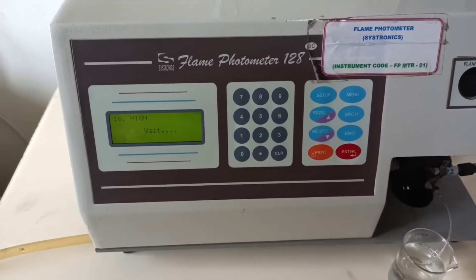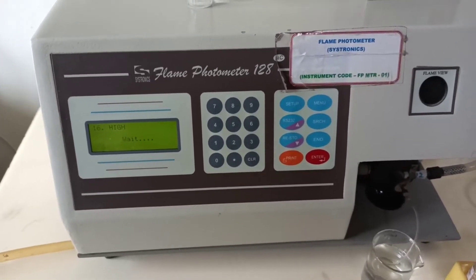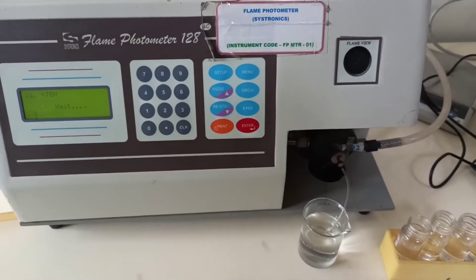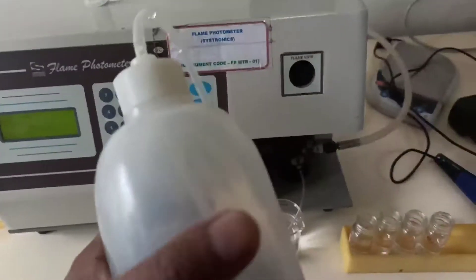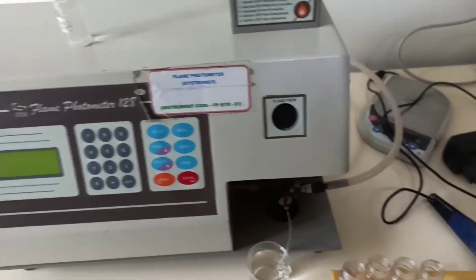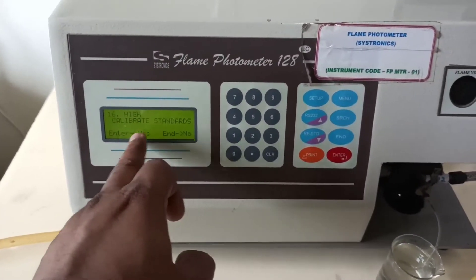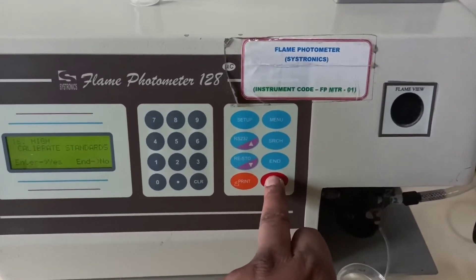We are waiting because the tube is being cleaned — the cleaning process is underway. This instrument is not as high-end compared to ICP; it is a low-cost instrument that any laboratory can purchase. Now we are moving to calibrate our instrument using the standards.